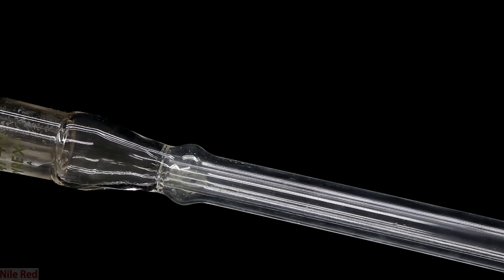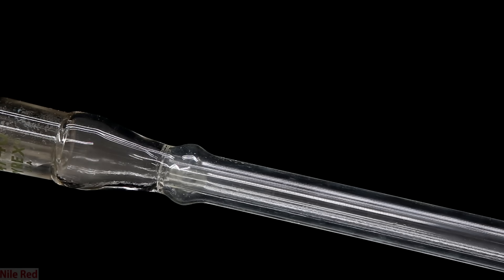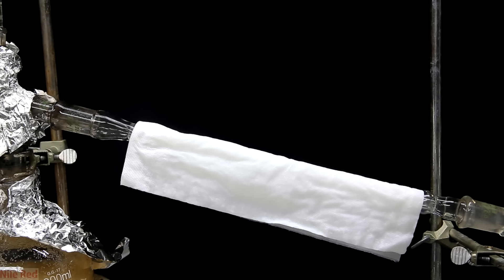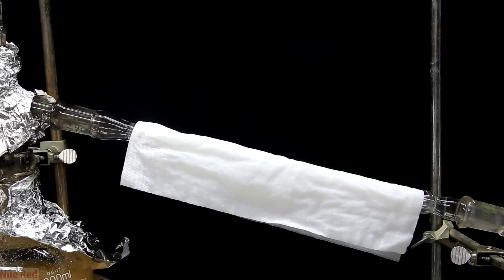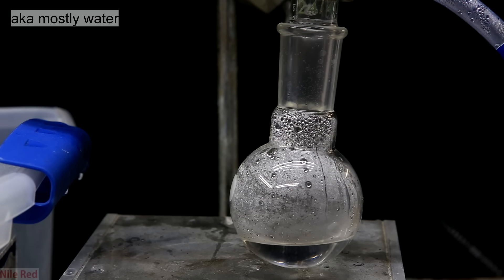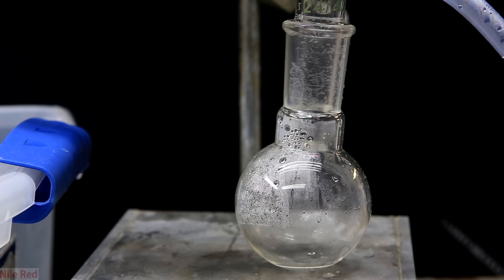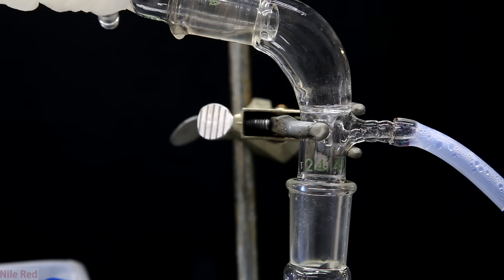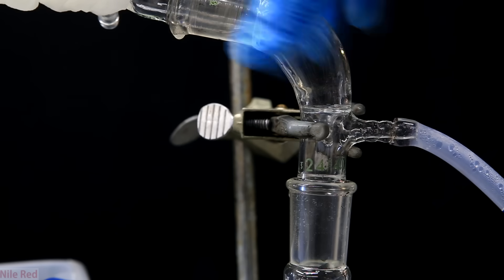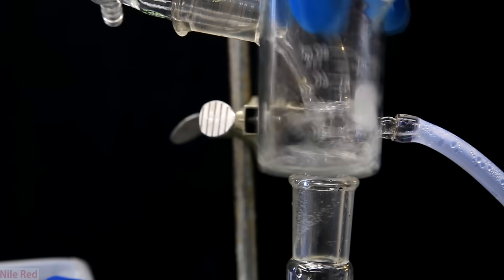After a while, sulfuric acid will start condensing in the condenser. In this case I don't use any water in the condenser — it's more than sufficient to be air-cooled, though you can add a wet paper towel to help cool it down if needed. At this point we'll be collecting pretty dilute sulfuric acid. Because the boiling point is too high and I don't have a thermometer to use, the hardest part is knowing when the concentrated sulfuric acid is coming over. At some points it's pretty easy to tell because there's clearly water vapor, but there will be a point where there's no water vapor but it's at something like 95% sulfuric acid.